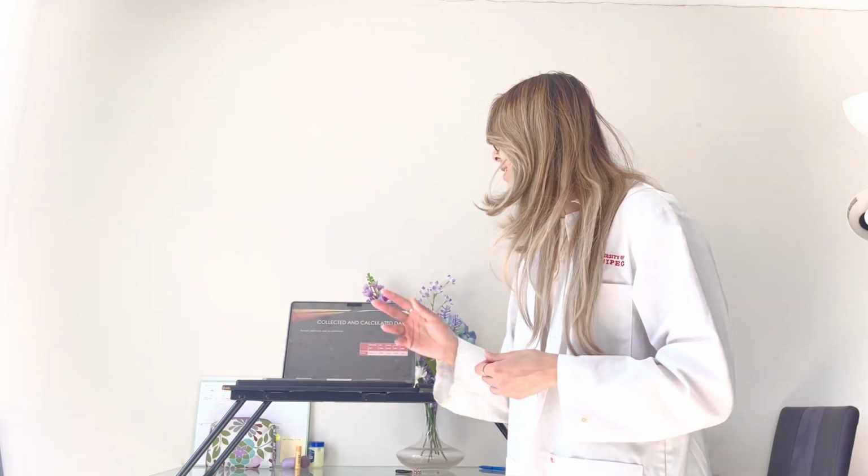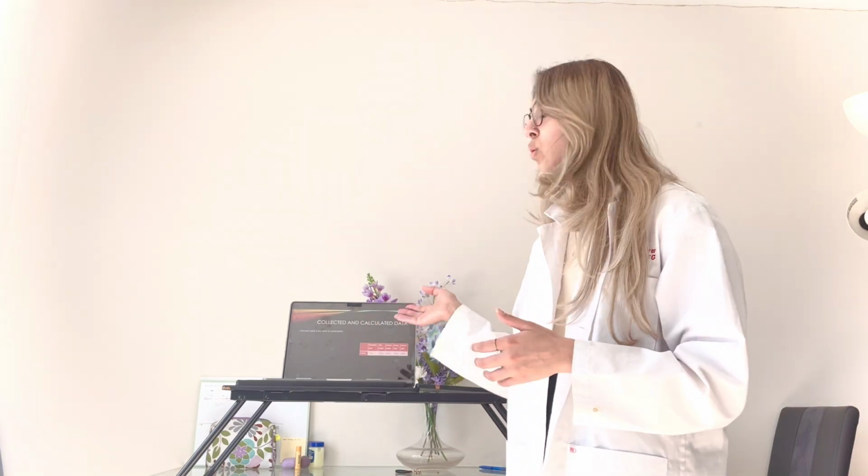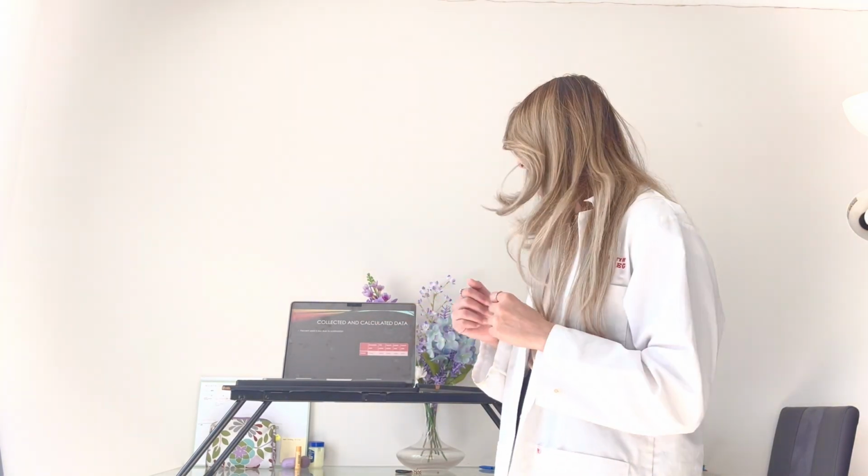The reasoning behind the actual yield being so low, hence the percent yield being so low, was the sublimation portion itself. The process of sublimation is supposed to lower your yield. It's supposed to get rid of most of that product when it's performing that process. So this was expected after all. And as we can see, our percent yield turned out to be only 6.56%. So we can assume how much that sublimation process took away right there.